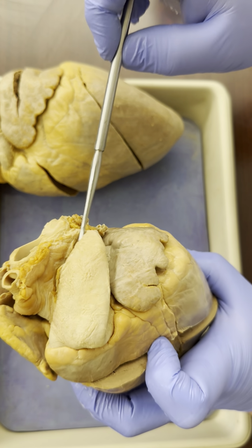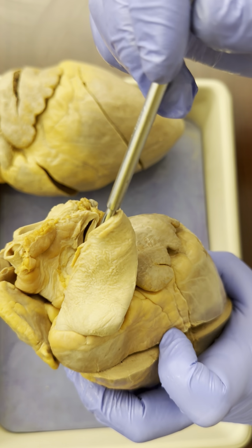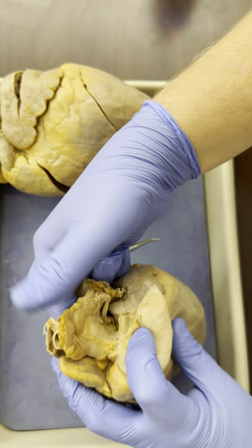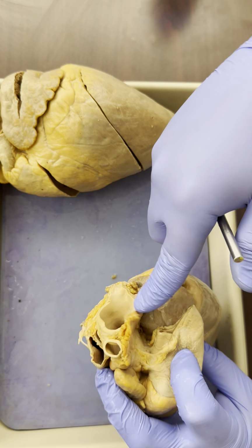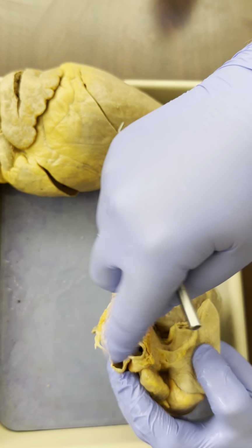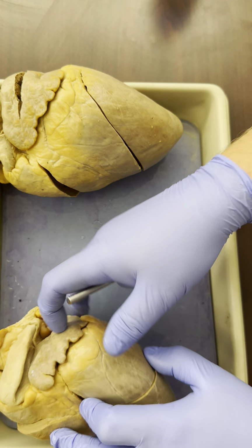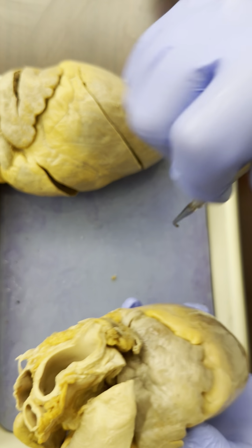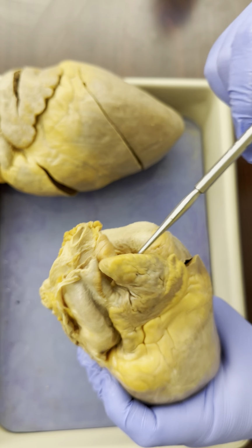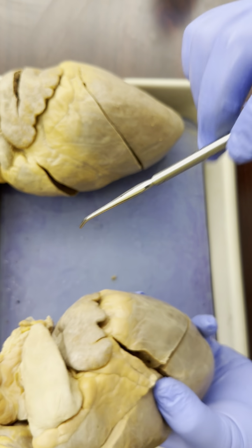Well, right here, the top vessel, right in front, this is the pulmonary trunk. Right behind it, the biggest vessel in the body, this is the aorta. You don't need to know the vessels coming off of it, remember. Here's that left auricle. So what's inside of here, this one is not dissected, but what is inside of here? The left atrium. Over here's the right auricle. What's inside of that? The right atrium.